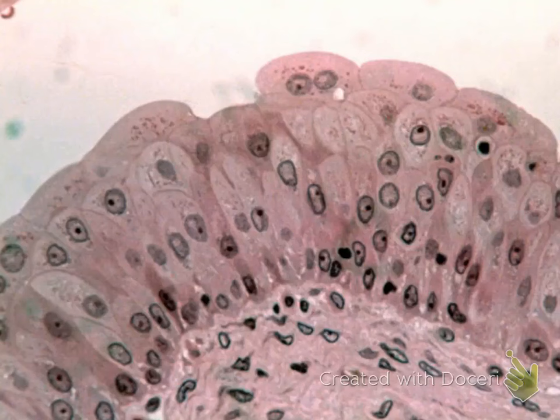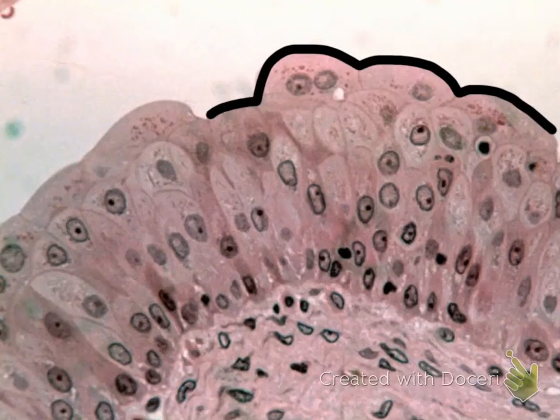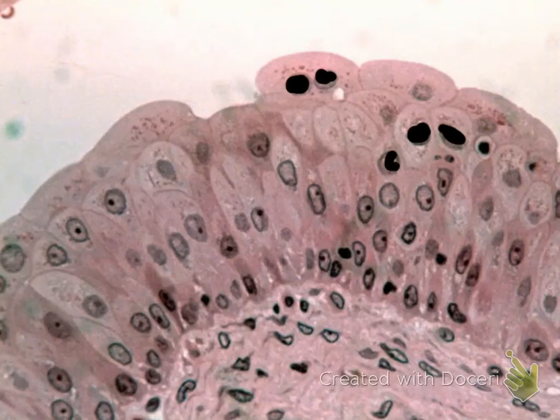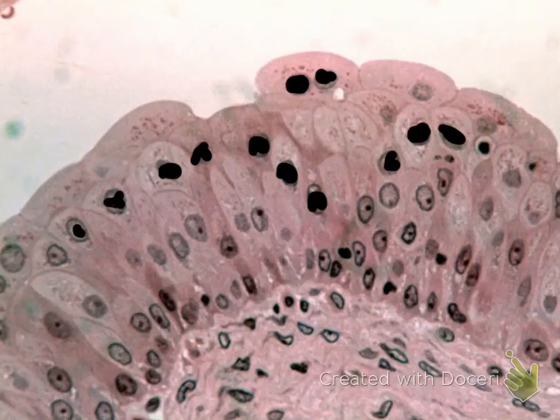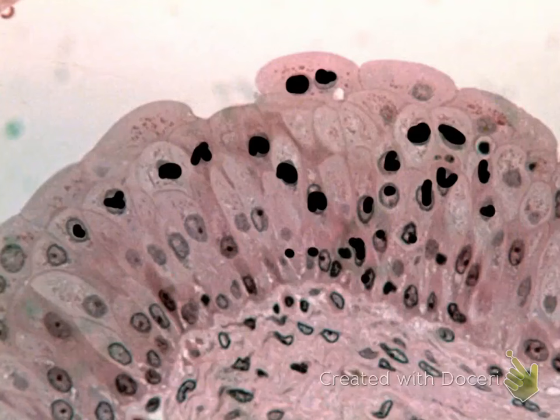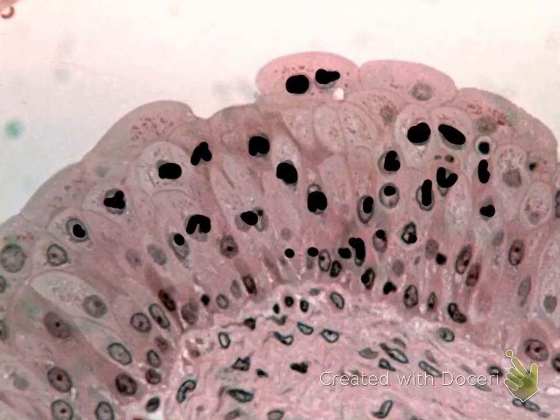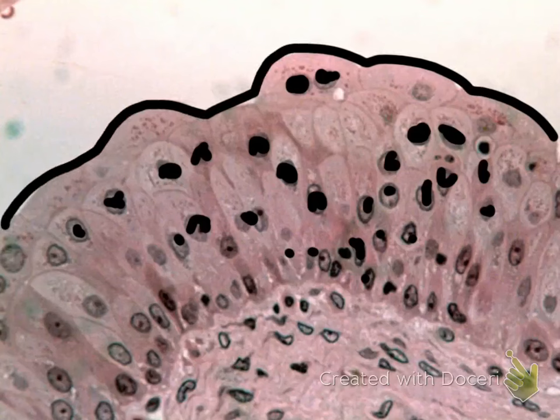The characteristics that you need to concentrate on is the scalloped or dome-shaped apical surface. The shape of the nuclei are round, which might suggest that it's cuboidal. Notice that there are multiple levels of nuclei, which means it's got to be some type of stratified, but you need to notice that the nuclei go all the way to the apical surface. The only tissue that has nuclei going all the way to the apical surface is transitional.